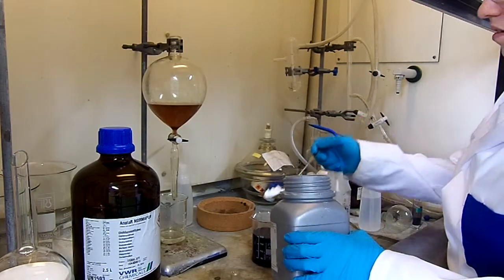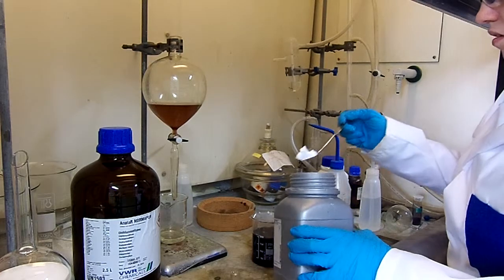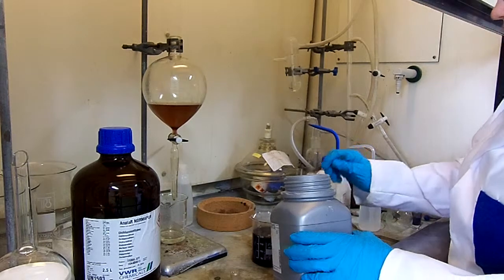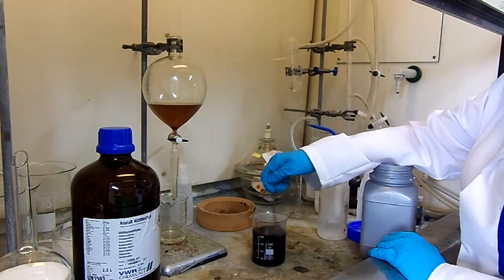Add magnesium sulphate to the organic layer and stir until no water remains in the solvent. A good test of whether it is dry or not is when you stir it, the magnesium sulphate will remain as a floating white powder in the solution, kind of like a snow globe.